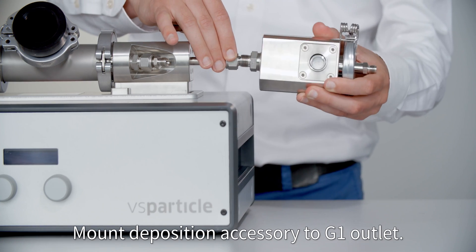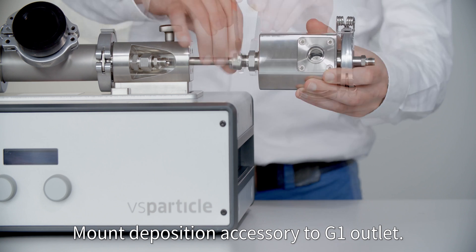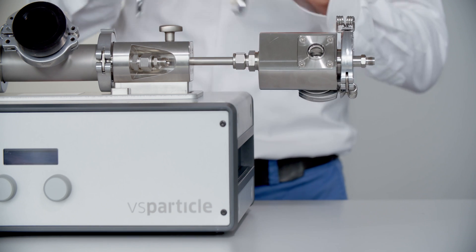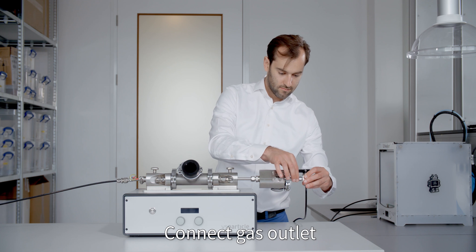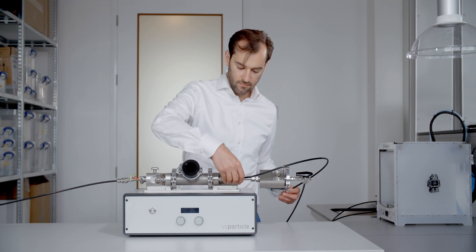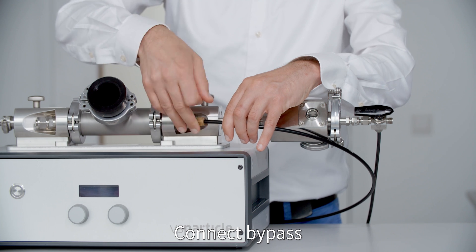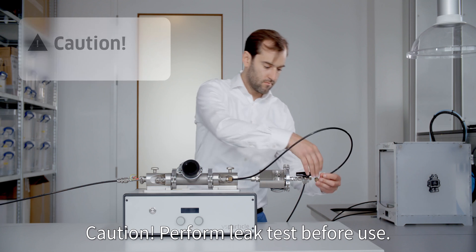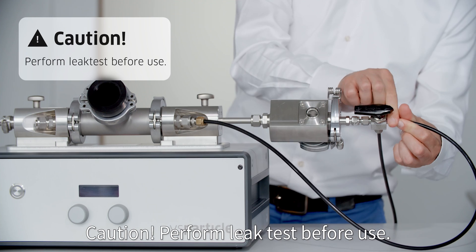Mount deposition accessory to G1 outlet. Connect gas outlet. Connect bypass. Caution! Perform leak test before use.